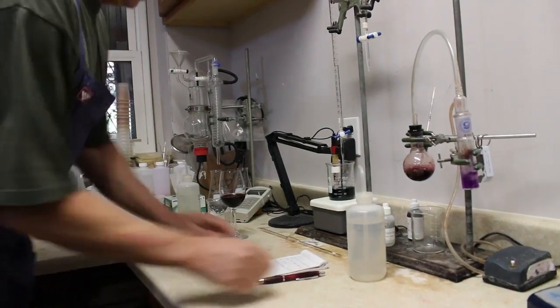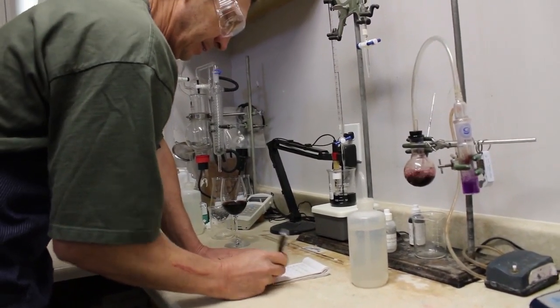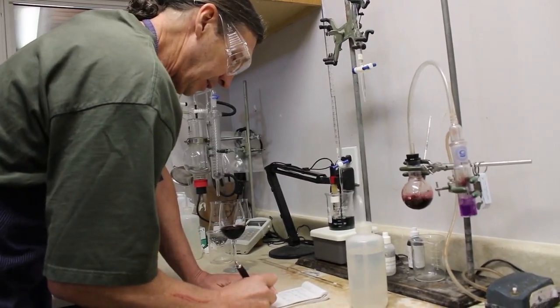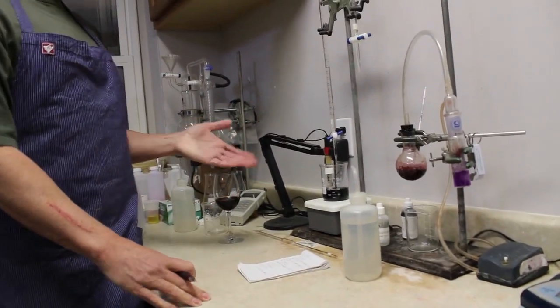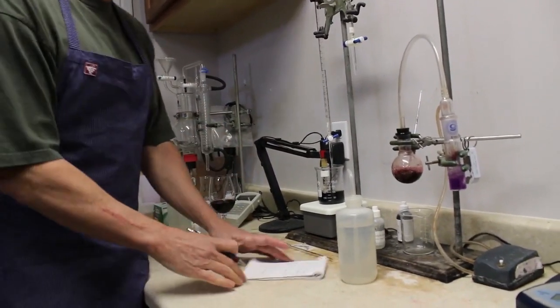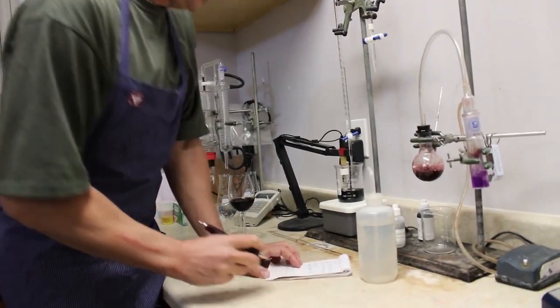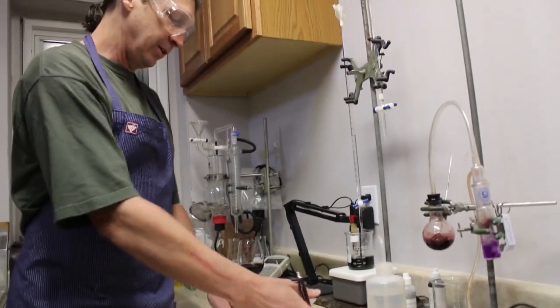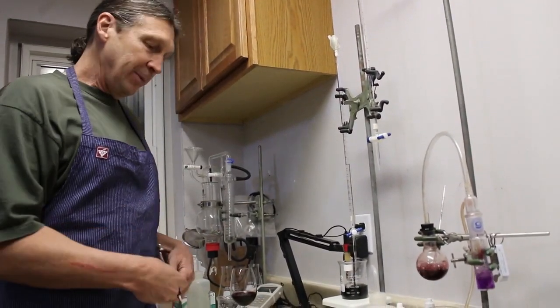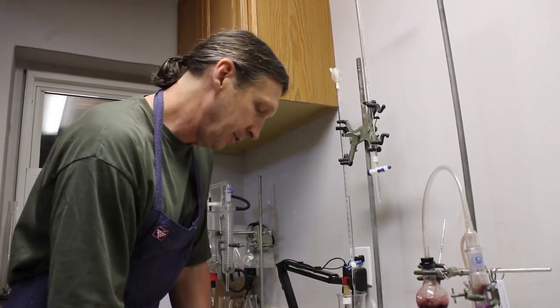So now I do my handy dandy math. 3.8 milliliters is how much I did. So using 5 milliliters of wine, I need to multiply this by 1.5, which is my magic number. You could research this later or give me a call. The magic number of 1.5 is going to give me the amount of acid in grams per liter.